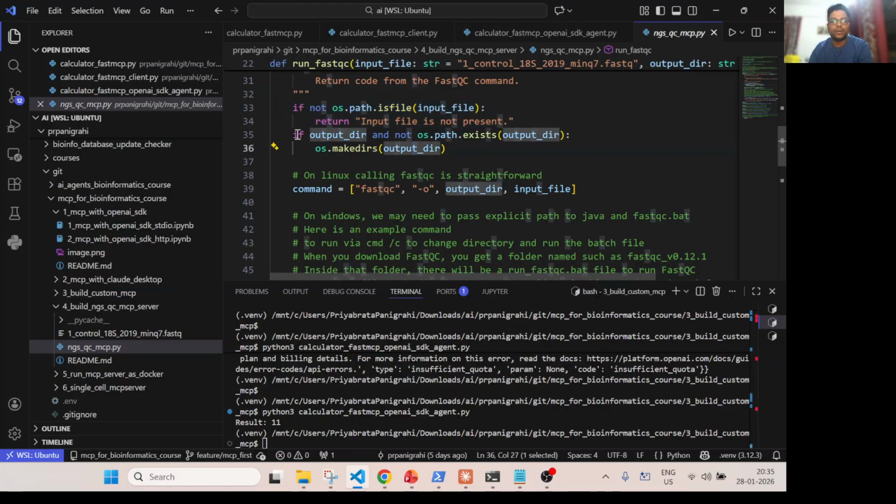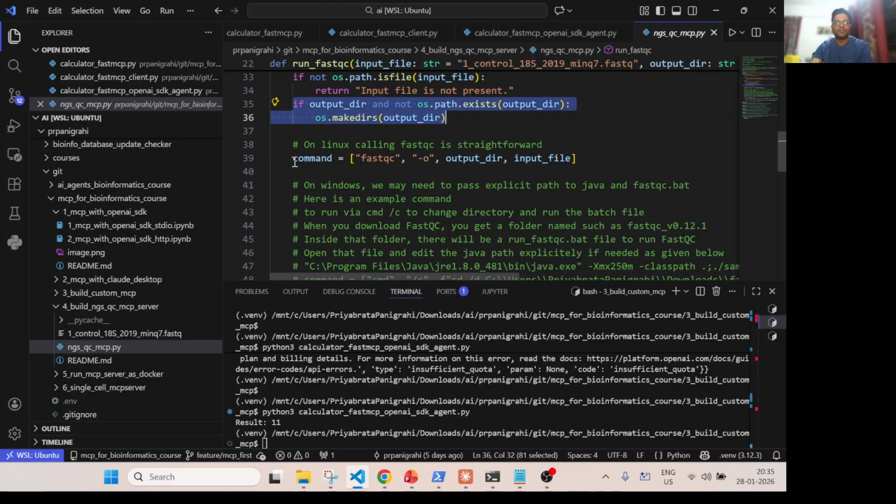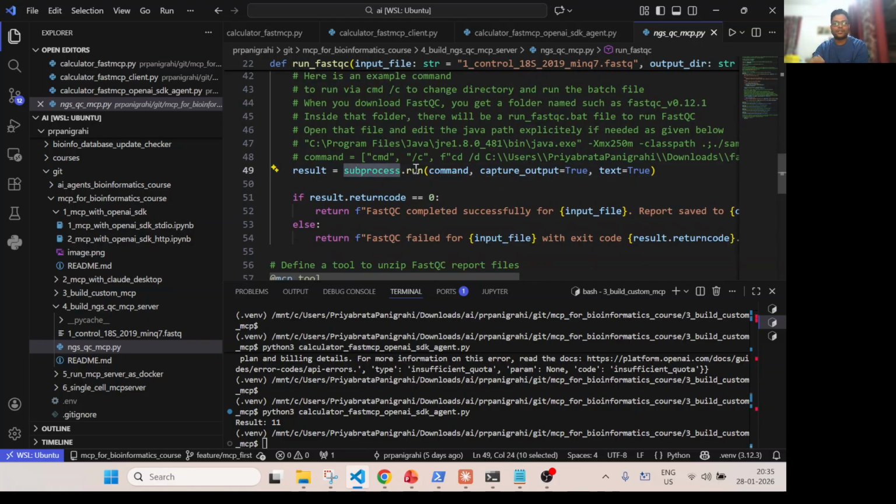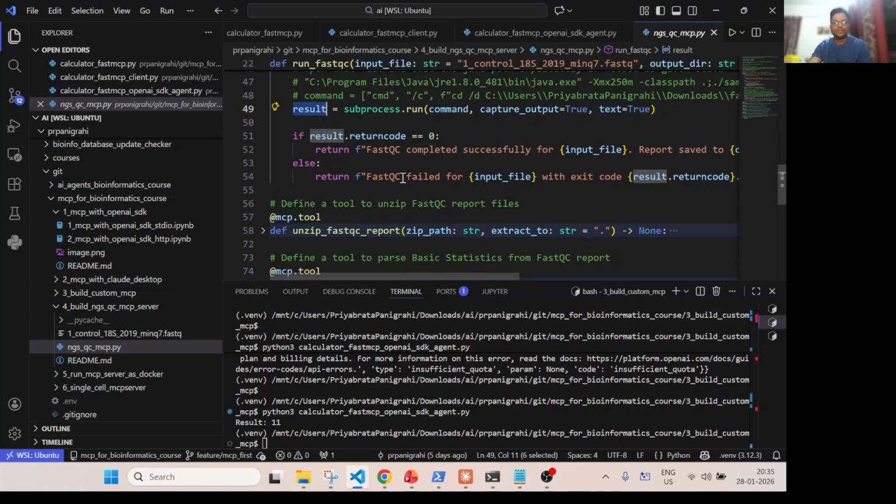And also, if the output directory the user has specified doesn't exist, it will create the output folder. And this is the command for running FastQC. I'm using subprocess.run and passing the command, and I'm storing all the output and any text response, capturing it over here. If my return code shows it ran successfully, I'm returning a message that FastQC completed successfully. Otherwise it will return the message that FastQC failed.